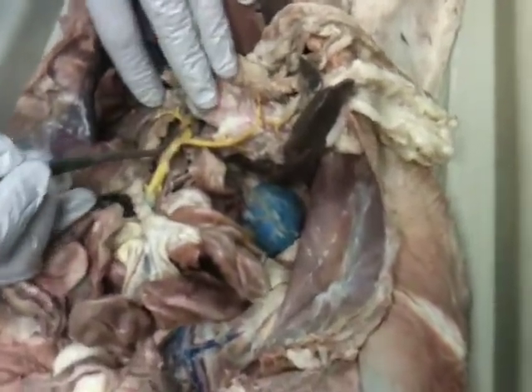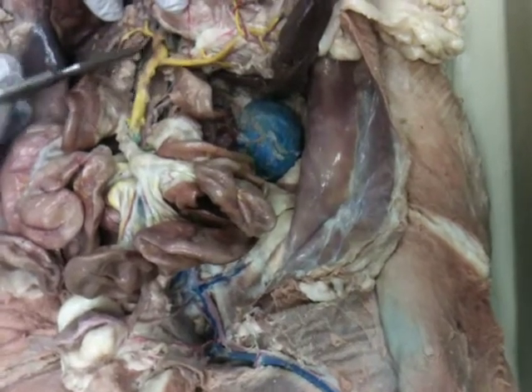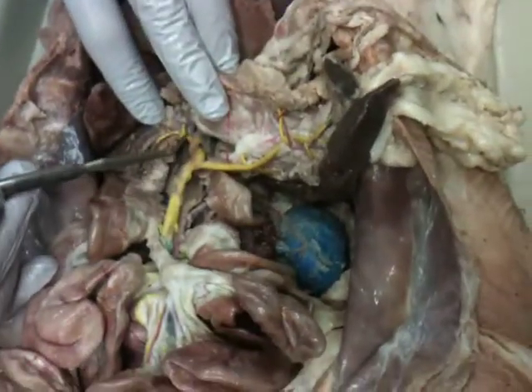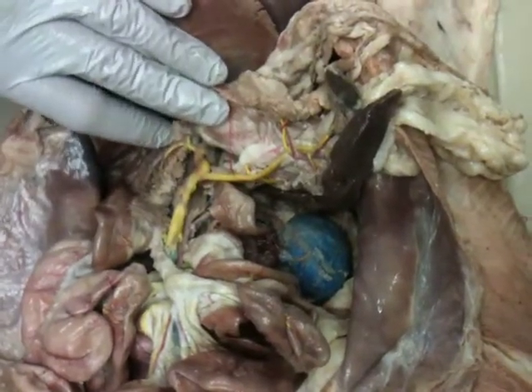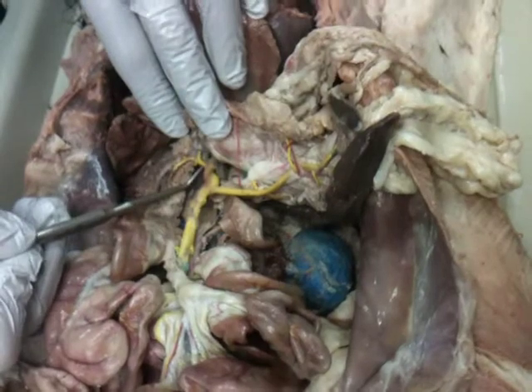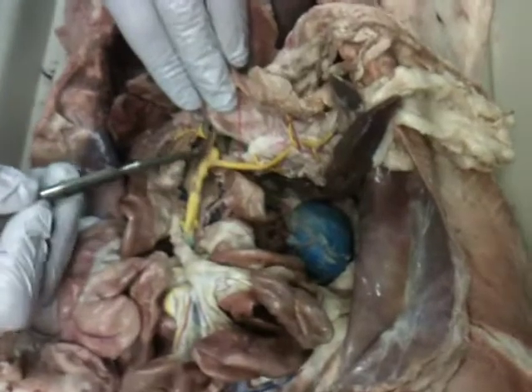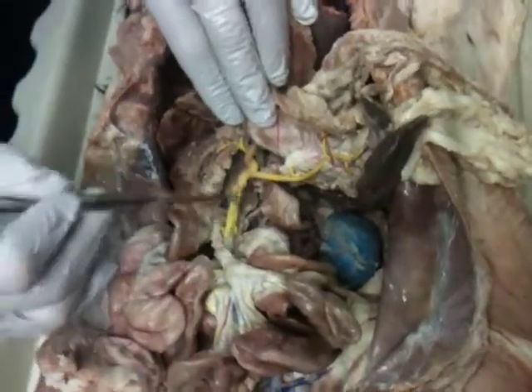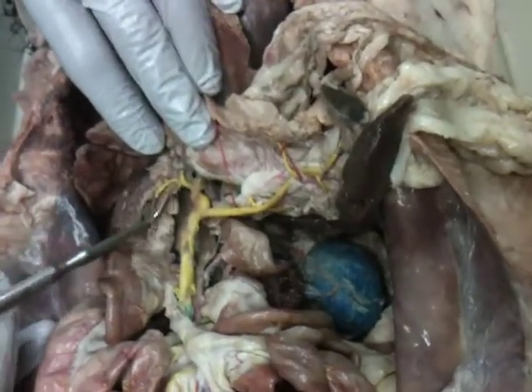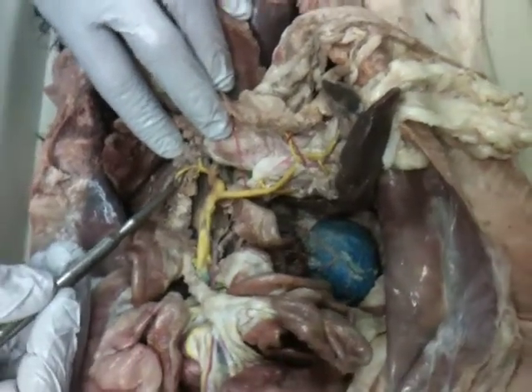Another vein going into the hepatic portal vein is this guy. Now look where it's going. Is that just your regular hepatic vein? Nope, now look where it's going. It's the pancreas. Pancreaticoduodenal, that's the vein. The long one. On the posting that's on Blackboard, I think I called it the posterior, but this is the anterior pancreaticoduodenal vein. It runs along with the anterior pancreaticoduodenal artery.